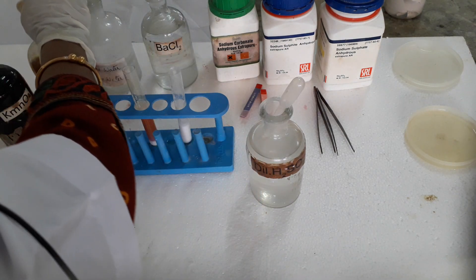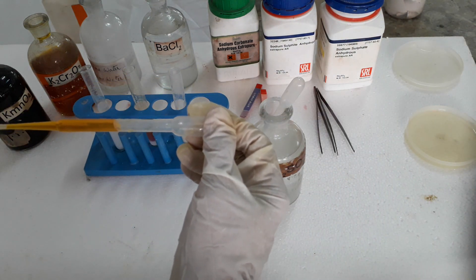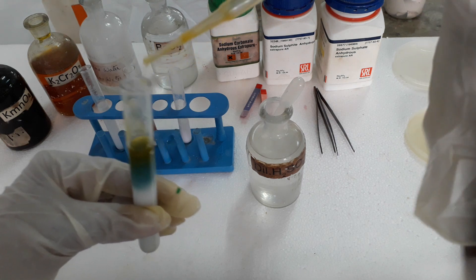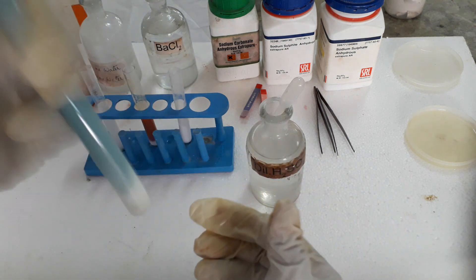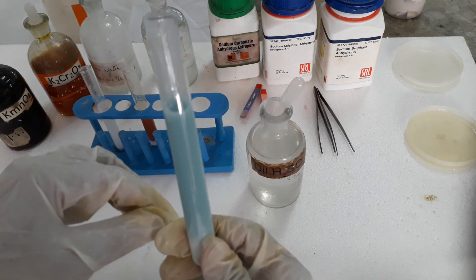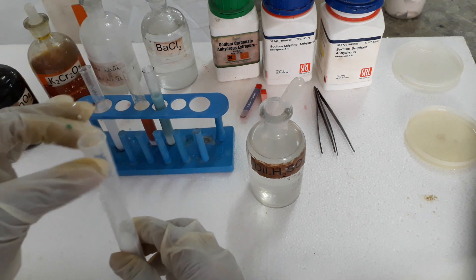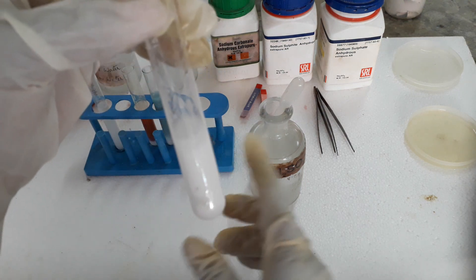The second test for sulphur dioxide: on adding orange potassium dichromate solution, the solution turns green — a very beautiful green color — which is chromium sulphate. So it is confirmed that the gas liberated is sulphur dioxide, and we can confirm that when the gas is sulphur dioxide, the salt contains a sulphite anion.